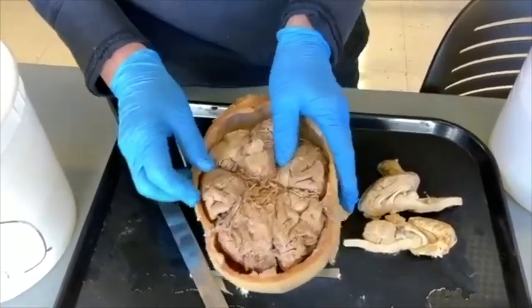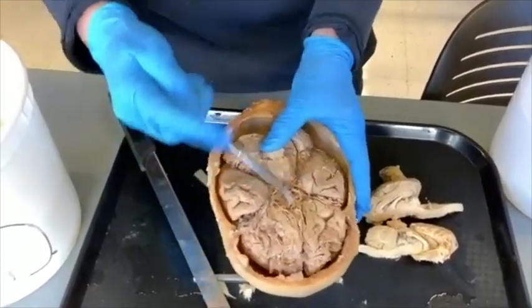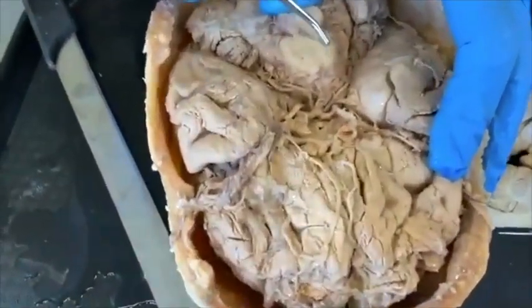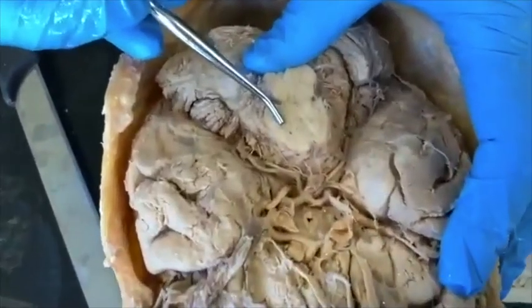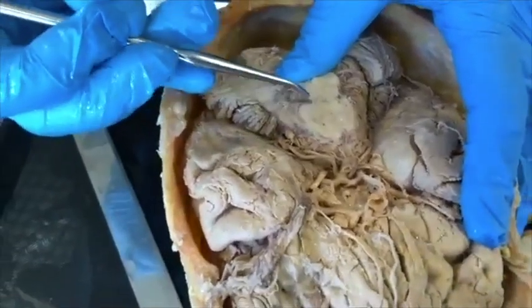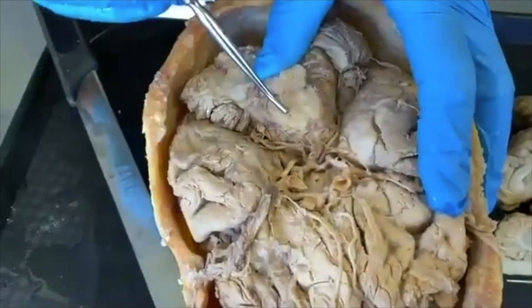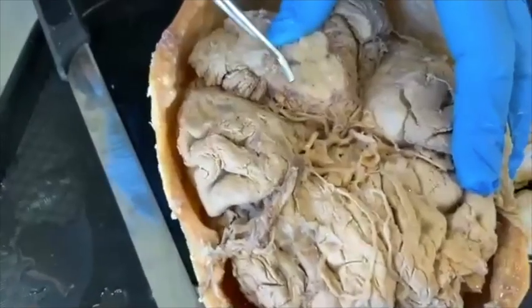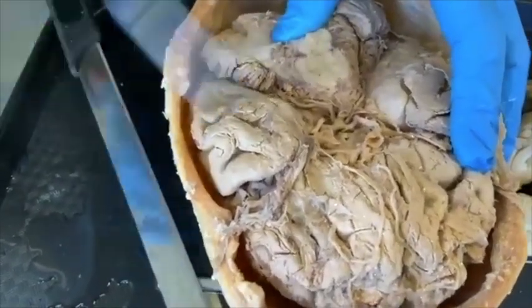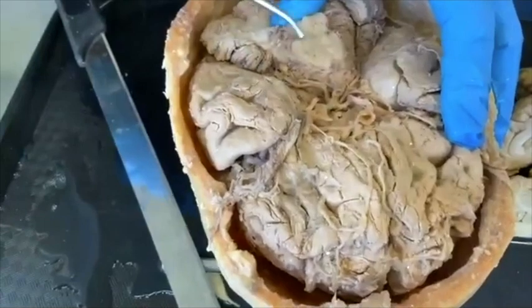Right here is the midbrain. You might be able to see a little bit of black here — that is the substantia nigra. These are the dopamine-containing cells. They also have a substance called neuromelanin, which is black in color when unstained. These are the cells that die in Parkinson's disease.